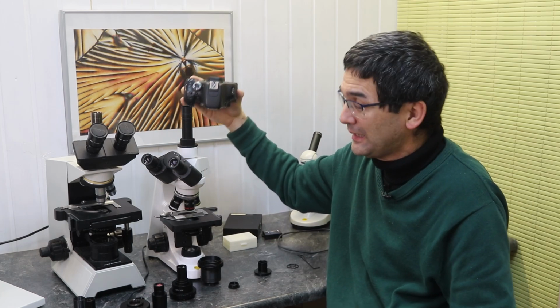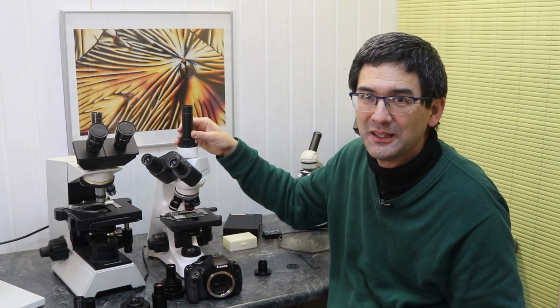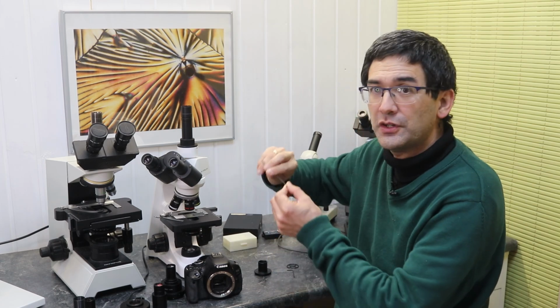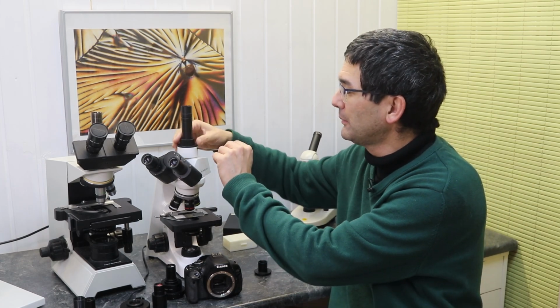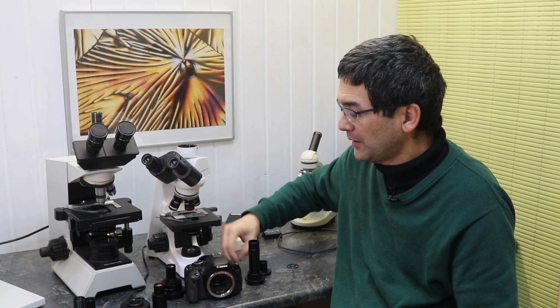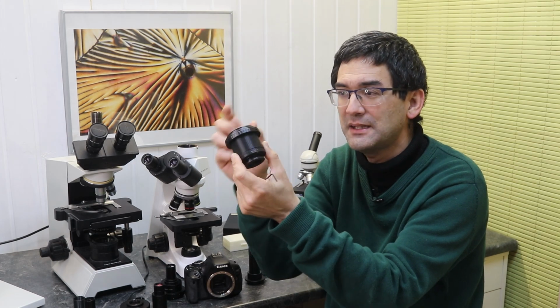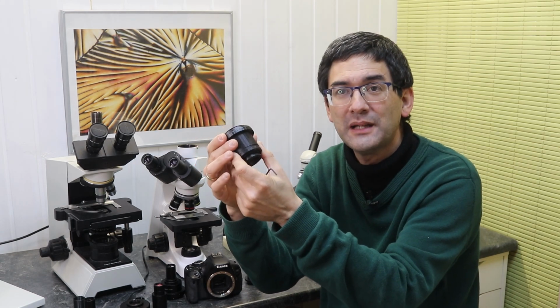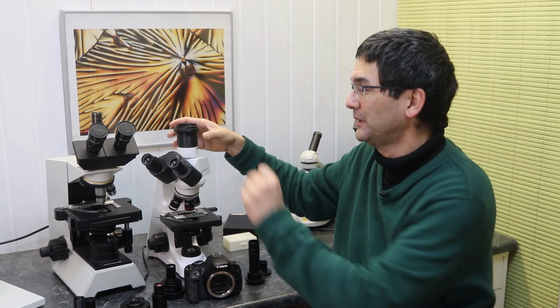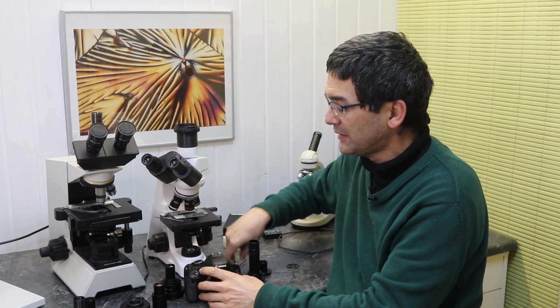And this is what I have done. The nice thing about this microscope is that it allows me to easily disconnect, and you see it's already a little bit wobbly, this top part here. I've got a little hexagonal wrench over here. I simply open it up here, and I'm able to completely remove this top part. Now I've replaced this top part with my homemade solution, which is made of 3D printed plastic. The top ring here is a T2 adapter ring, again a camera specific ring, and then all I have to do is put it in here, tighten it again, and I'm able to directly connect my camera.